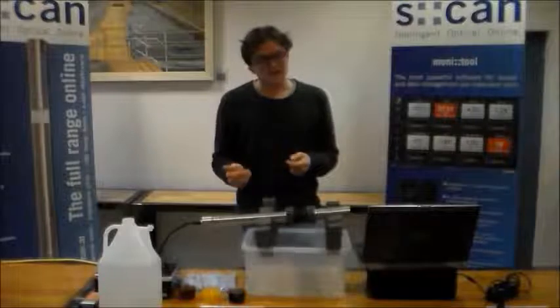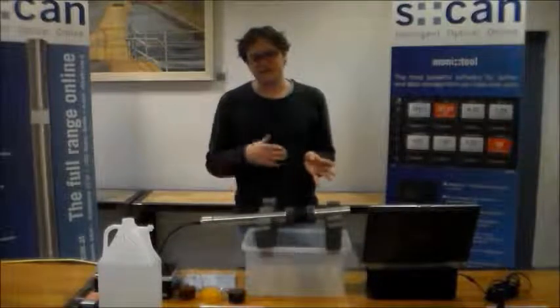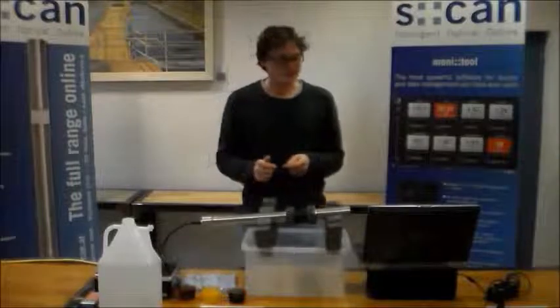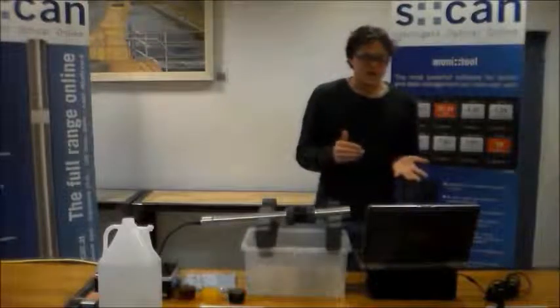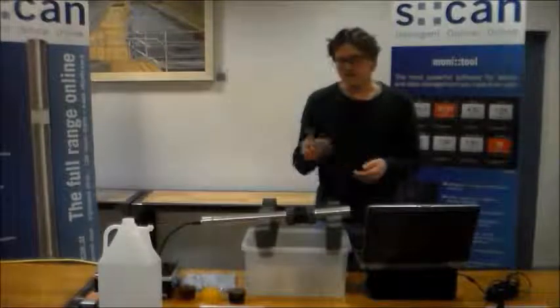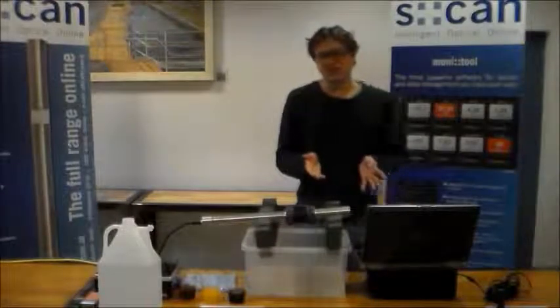So that means by modifying our feedback to the different events we see in the data, we can modify the behavior of the different algorithms. So that means, do we want to see a reaction of the alarm algorithm to a certain substance or not?